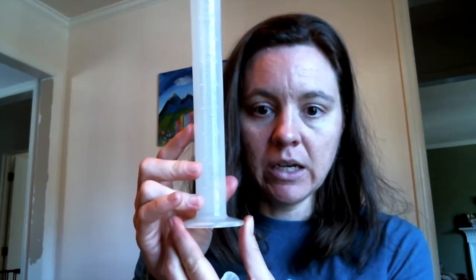All right. So for the pH test, I need 10 milliliters of water. So I'm going to use my handy dandy graduated cylinder. I'm going to fill it up to the 10 milliliter mark and then put that into my test tube. Okay, I think I got 10 milliliters of water there. So I'm going to pour 10 milliliters of water into my test tube. And of course now the Secchi disc wants to come out.